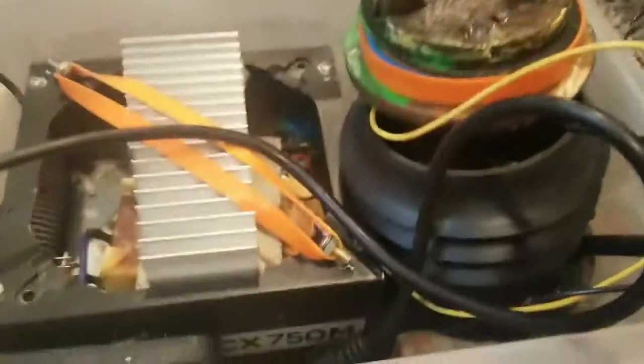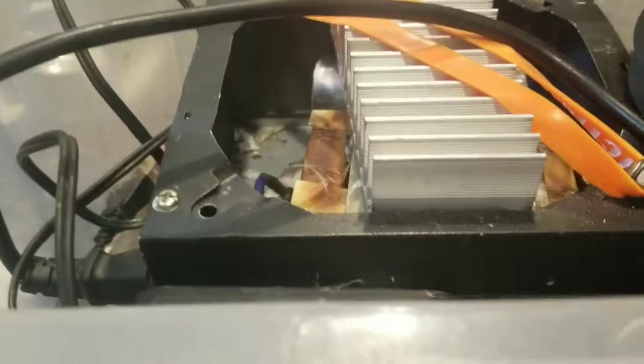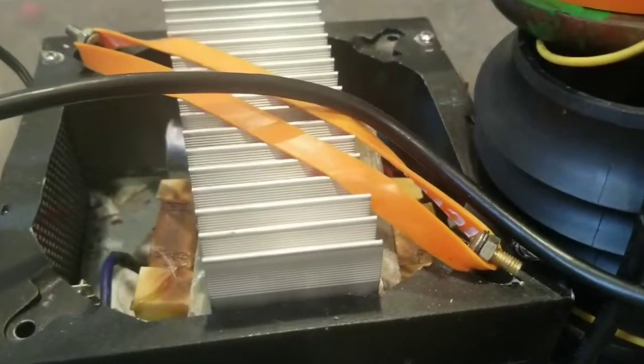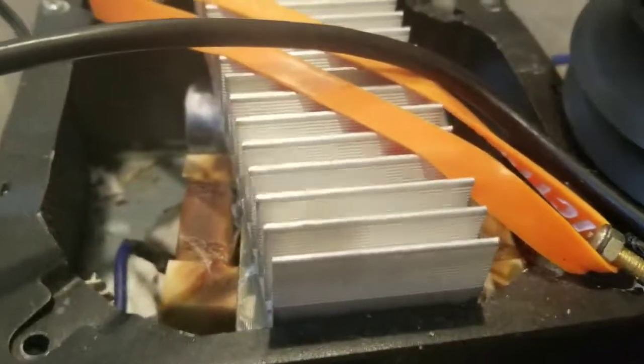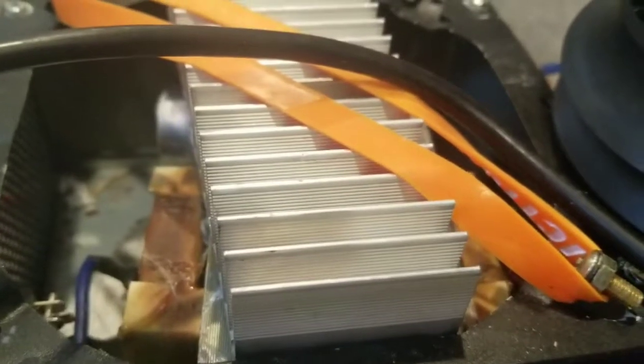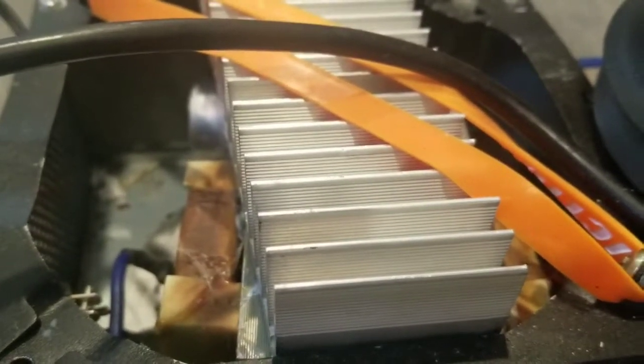To synthesize nitric acid, I am going to be using the Birkeland-Eyde process, which is used industrially. They have giant industrial Birkeland-Eydes that are used to make nitric acid to make all the fertilizers that the world needs. Anyway, I'm going to start with my power supply. This is the microwave oven power supply that I showed you in a previous video. I didn't make any major modifications, so it still has the overheating problem, but I am soon going to get a paint can and turn it into an oil-cooled transformer, so that I can run it for longer periods of time.